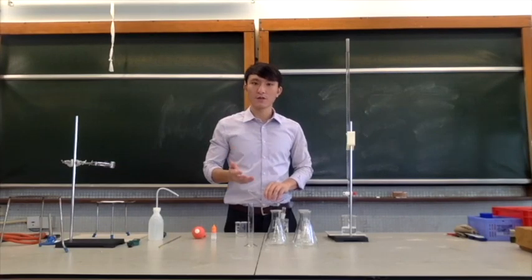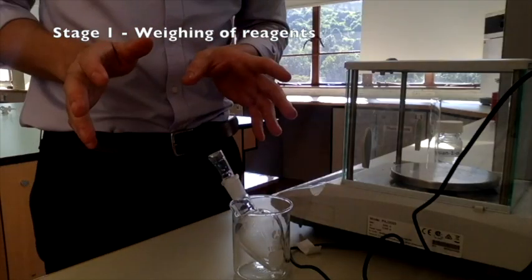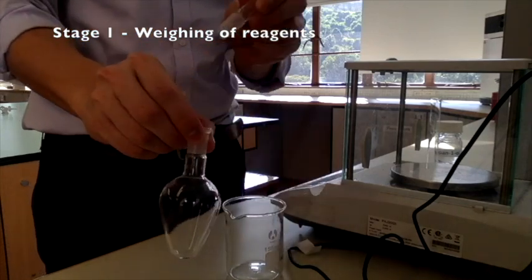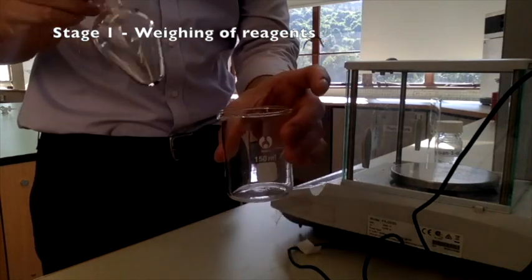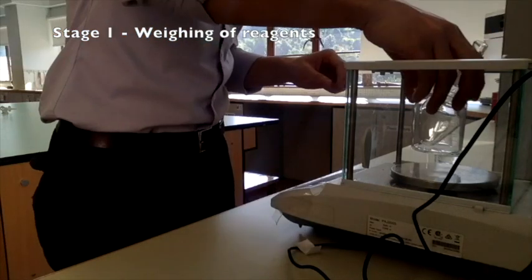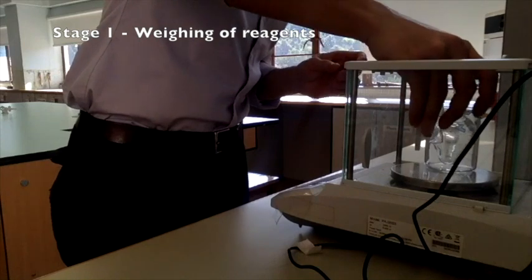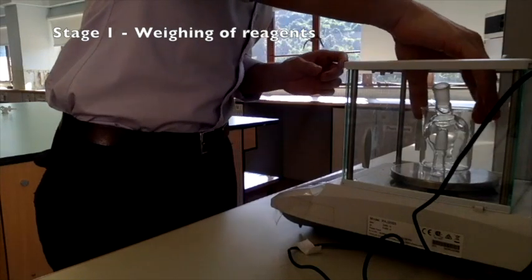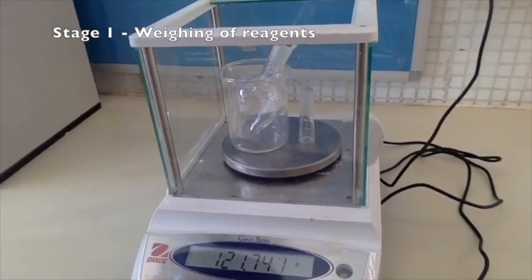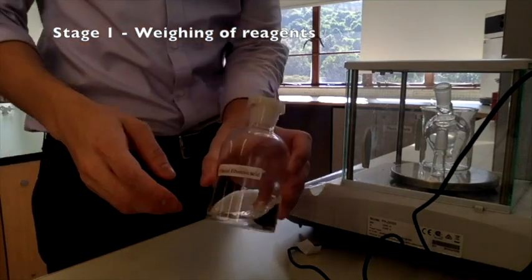So let's move on to the first stage. Okay, so during the first stage, we are going to weigh our sample. So we will have our pear-shaped flask with the stopper here, and we need a beaker to hold it. So in the electronic balance, we will put it inside. We will also put the stopper here. Okay. The reading over here is 121.742.